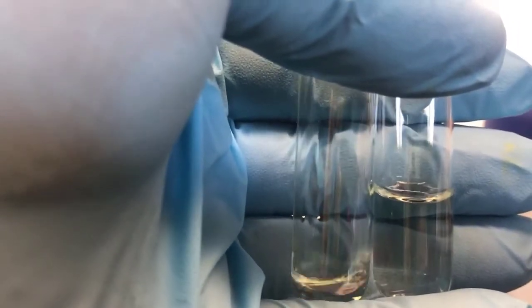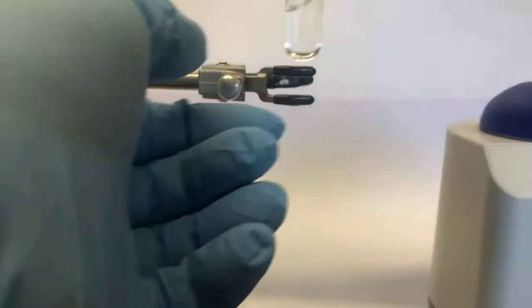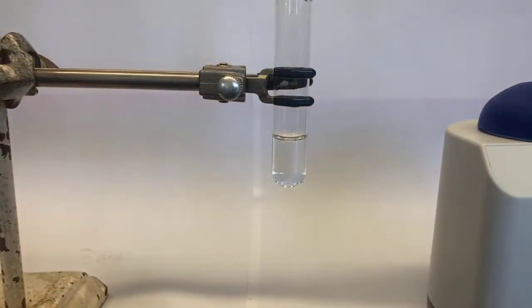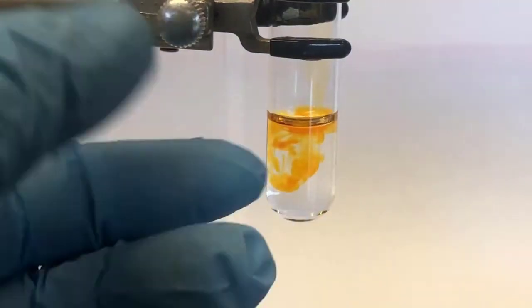Fill another tube, but this is for the acetic acid dissociation portion of the experiment. I need about 3 mL of deionized water. So I've got that. That's my reference I removed. And I'll place this in here and I'll make my additions. Okay, so I'm going to add 1 drop of methyl orange indicator, and I'll try to do this fairly precisely. I don't want too much, it'll be too dark. So there's my 1 drop of methyl orange, and then we'll agitate it a little bit, get it distributed.